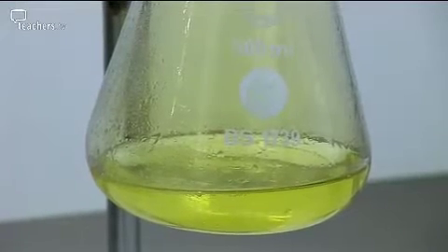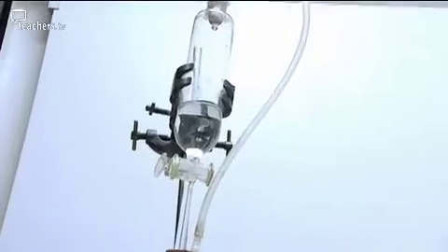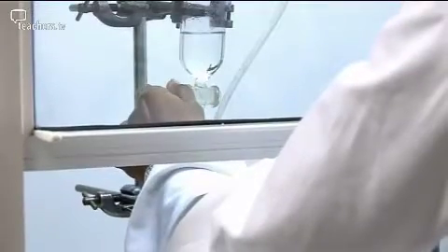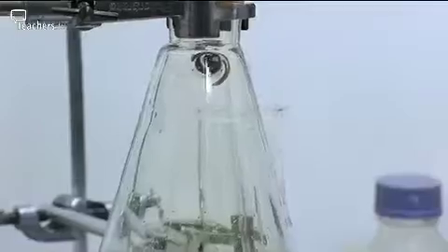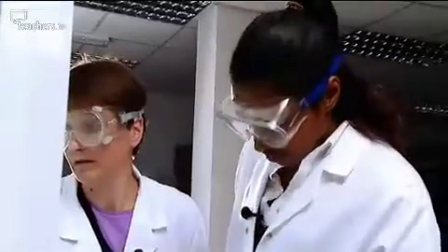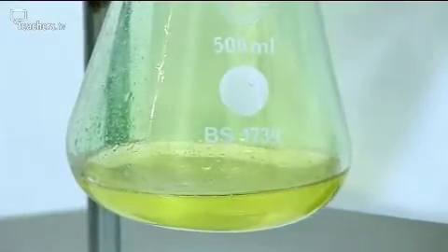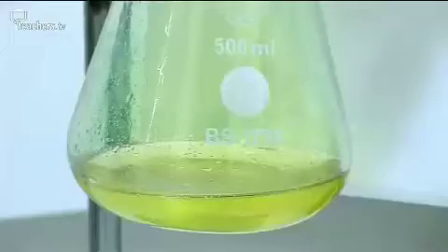CLEAPSS recommend generating chlorine by dripping 5 molar hydrochloric acid into freshly bought sodium chlorate(I) solution. And then we just slowly drip the acid from the tap funnel into the solution. You see it's just reacting. So that definitely looks green. It's always a clue that you've got chlorine gas. If we just put the... Definitely chlorine gas in there.